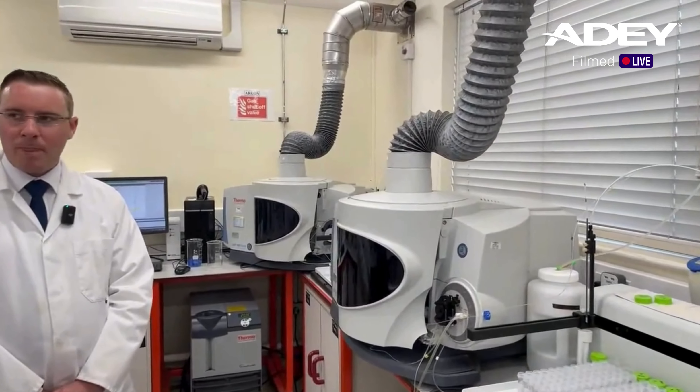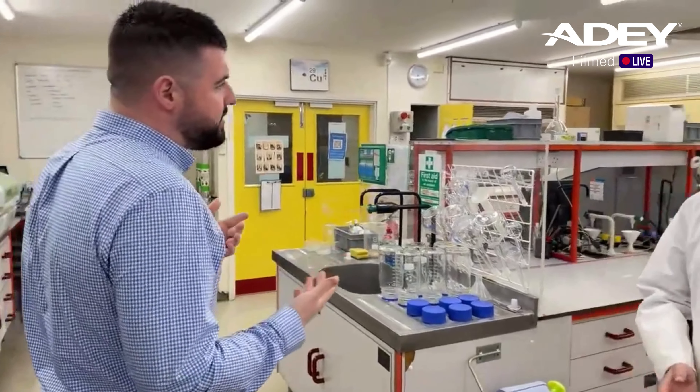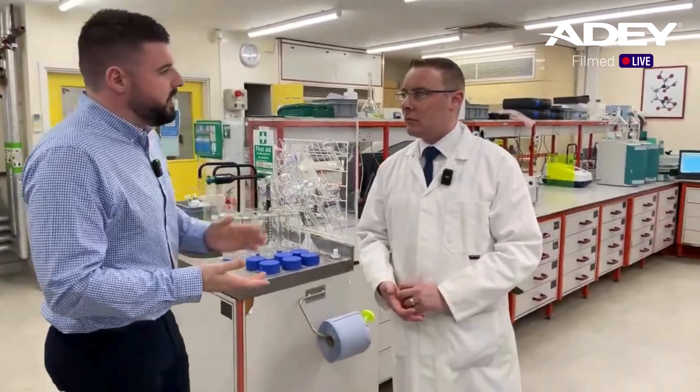So guys, it gives you a really great insight into what happens when you send a sample, and the quality being delivered here is phenomenal to be honest. Another thing I wanted to speak to Josh about was MC1 Plus inhibitor. So we mentioned that it's performance tested. I've heard a bit about NSF ratings and approvals, and I'm just really interested to know when you performance test MC1 Plus, what tests are we doing, and how can we confirm that it's always good?